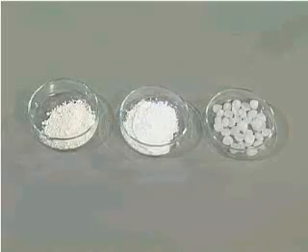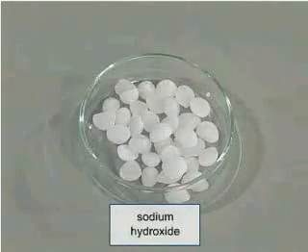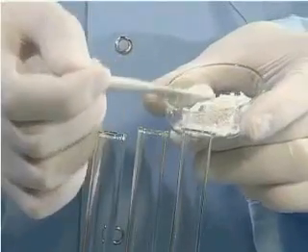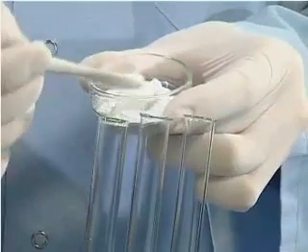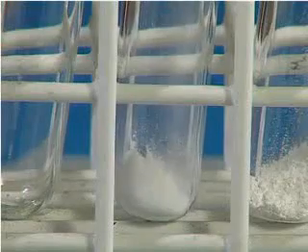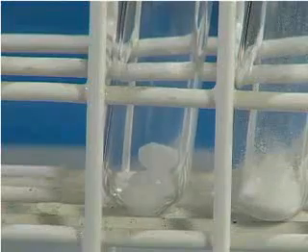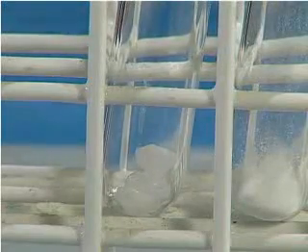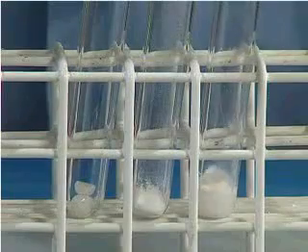Let us investigate the water solubility of calcium, magnesium, and sodium hydroxides. We will do an experiment for this purpose. We add equal small amounts of calcium, magnesium, and sodium hydroxides to 3 separate test tubes. Next, we add water so the test tubes are 1/3 filled.